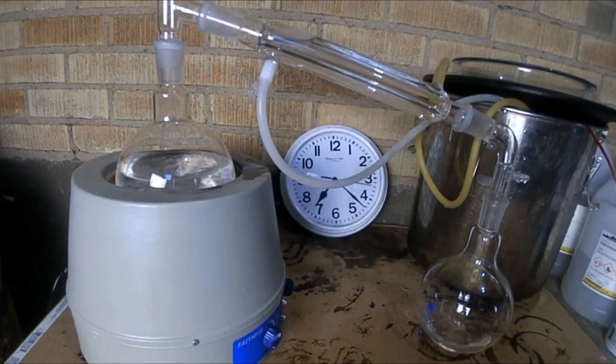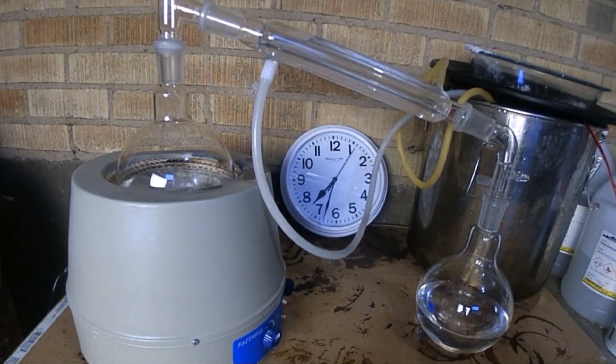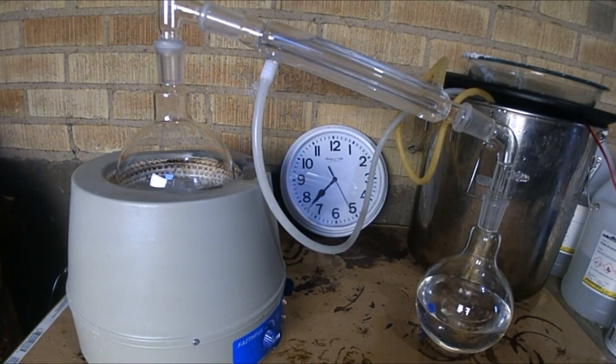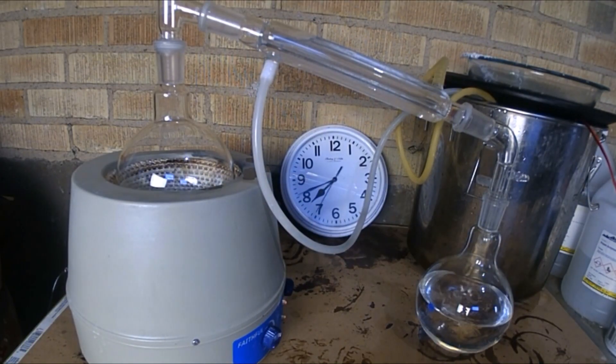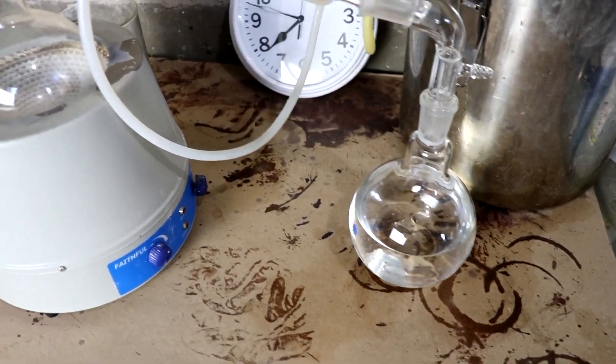Alright, seems to be working well enough. I am realizing this is going to take a long time to do all six of those cans, though. Maybe I'll just stop after a couple of them. And that's just about it.